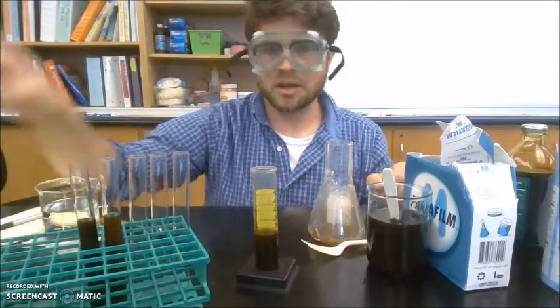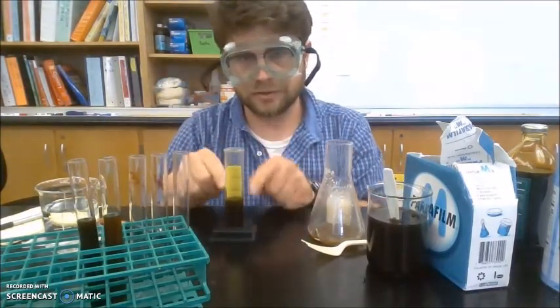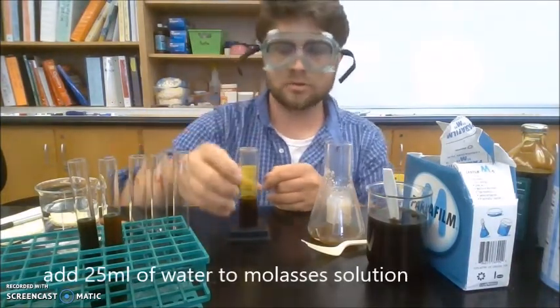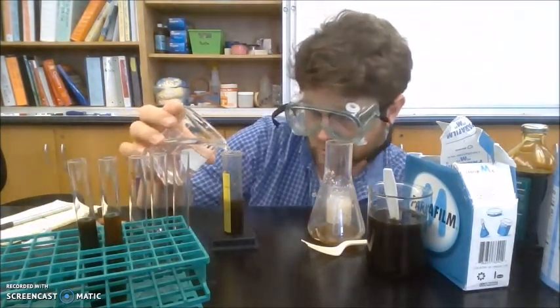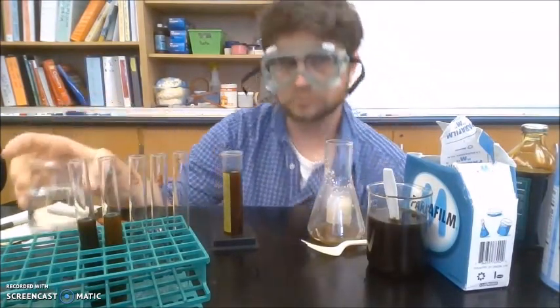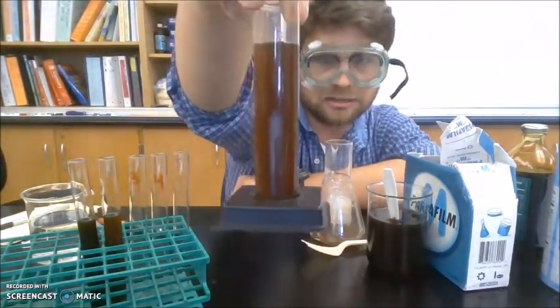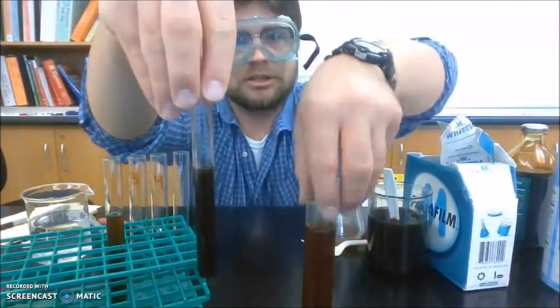Okay. So now, to this 25 milliliters of molasses stock solution in water, I'm going to add another 25 milliliters of water. Okay, and so if you see, take a look at the color compared to what we originally started with.